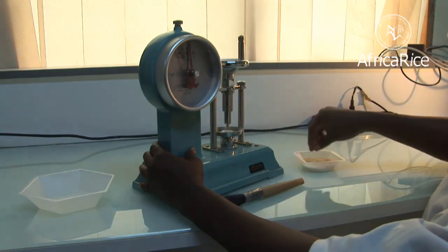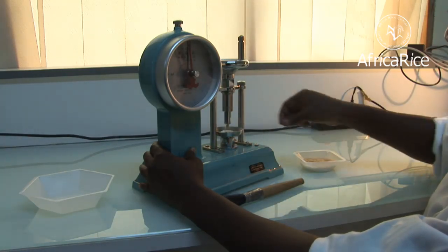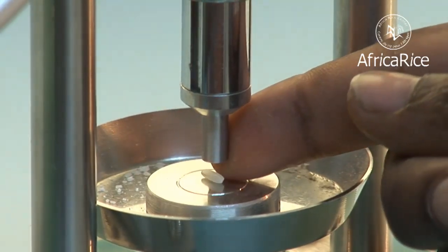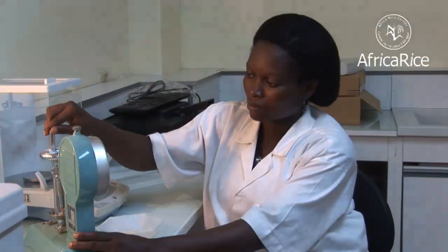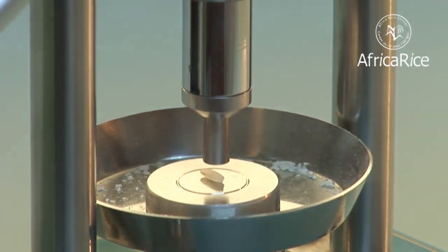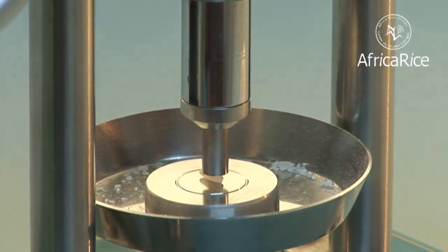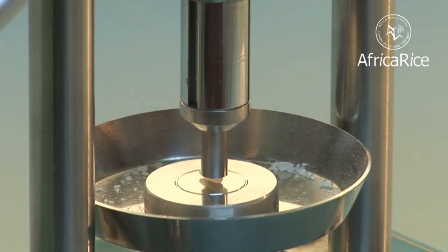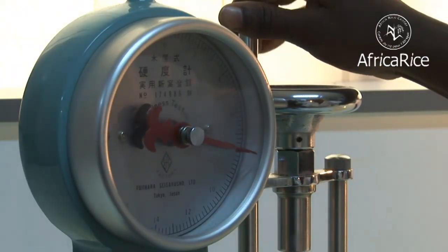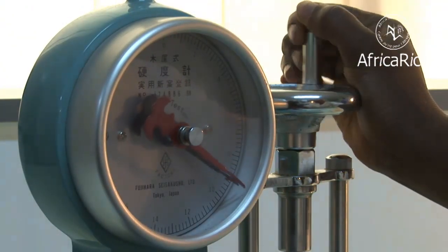The Africa Rice Grain Quality Lab also measures the hardness of rice grains using a grain hardness tester. Grain hardness, as well as moisture content, are important parameters that determine the levels of breakage during milling.